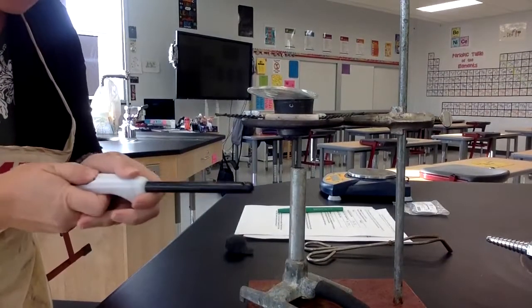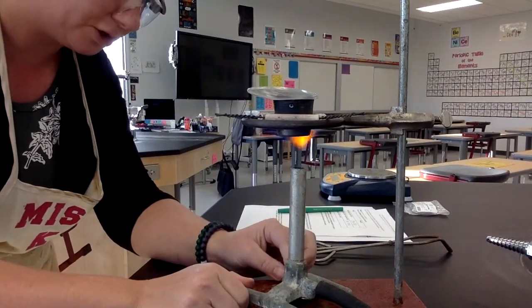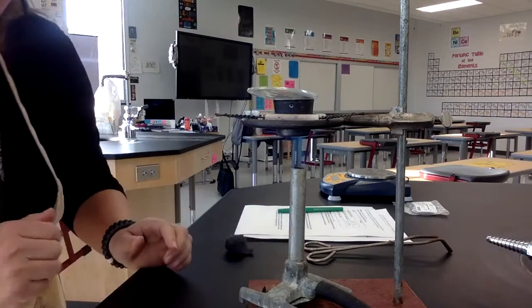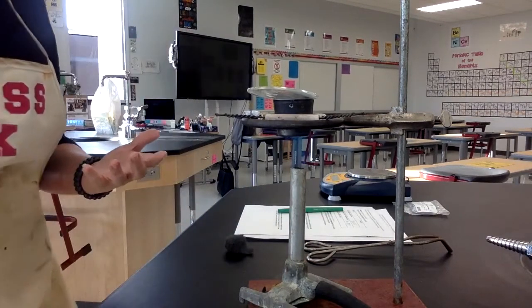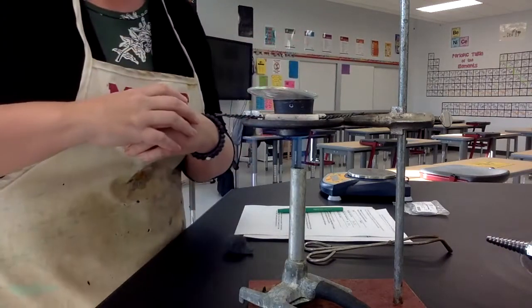All right, so I'm going to turn on my gas. Maybe you can hear that. And then I'm going to light my Bunsen burner and make sure this is as hot as it can be. Can you hear that? It kind of sounds like a jet. All right, so now this is the waiting time.